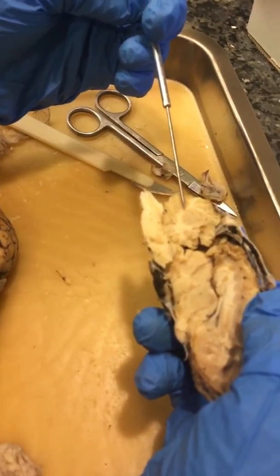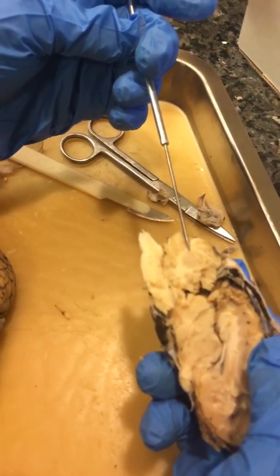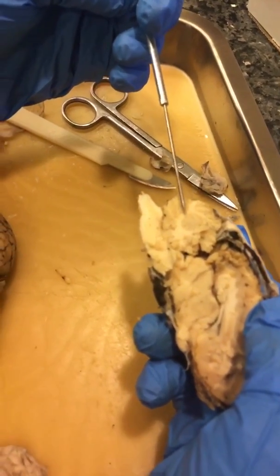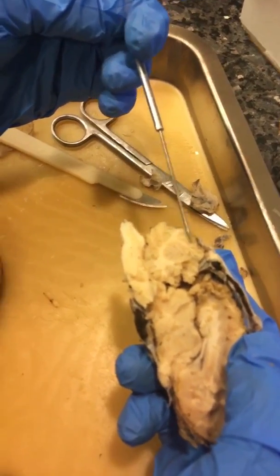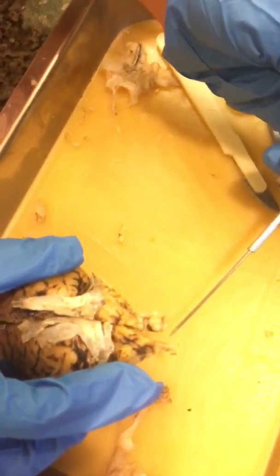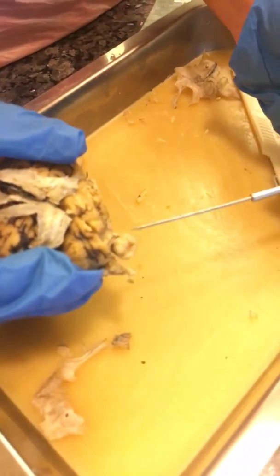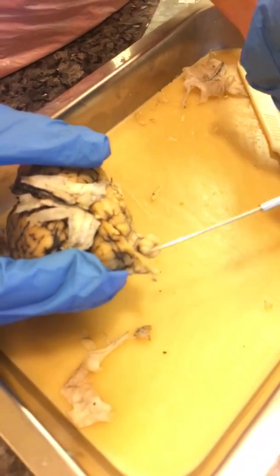Here we have the arbor vitae, and it looks like a tree, kind of, if you can see. And on the very end of the sheep brain is the spinal cord — it's already been cut in half, but you can see it's very visible.